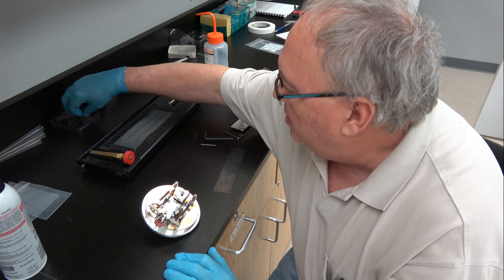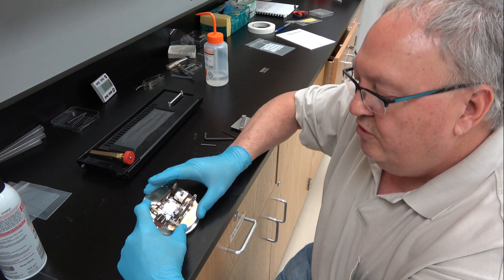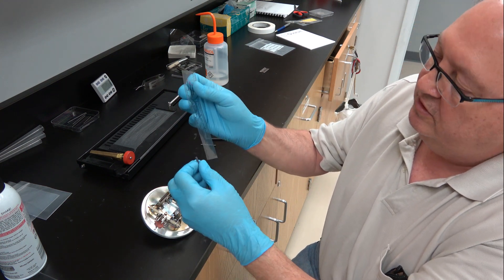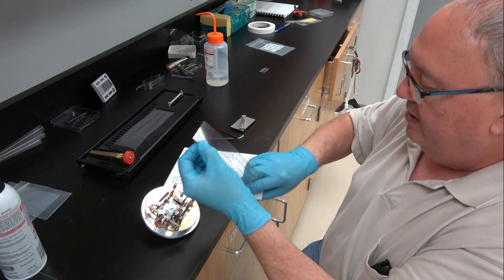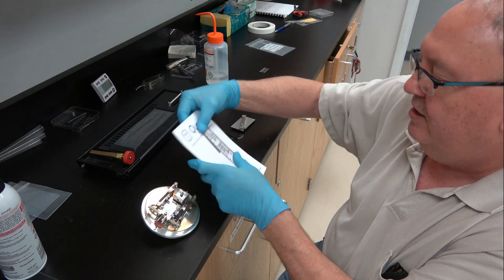There's a movable side and a fixed side. The maximum rod length for the movable side is 60 millimeters. It's a little tough to see here unless I can get a white background to show you, but the maximum length is 60 millimeters.